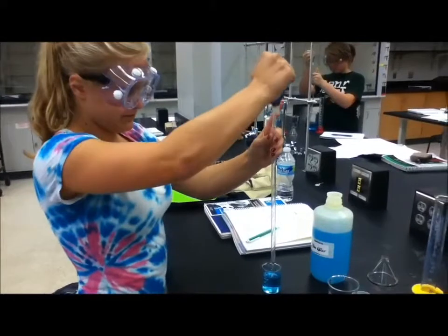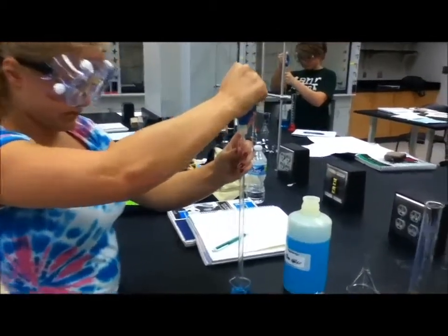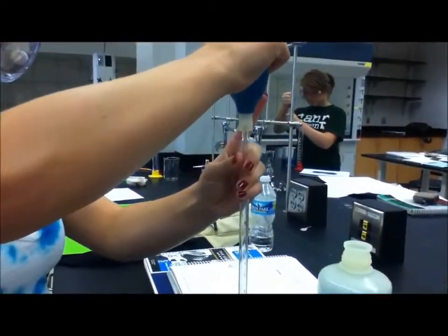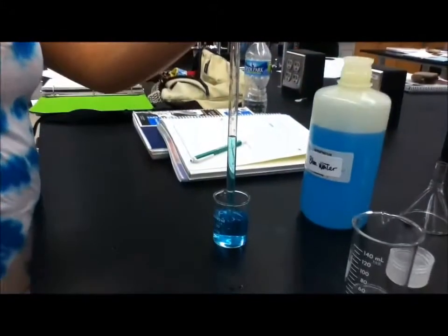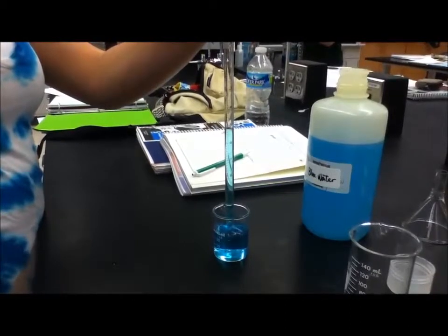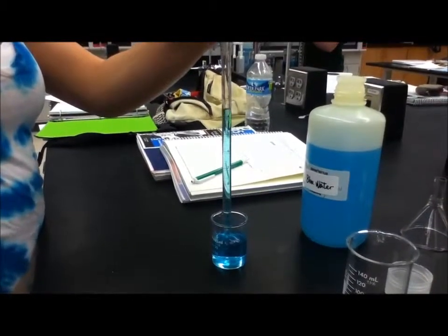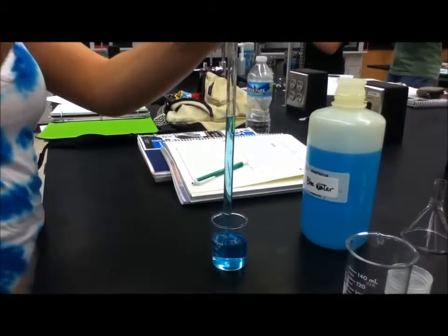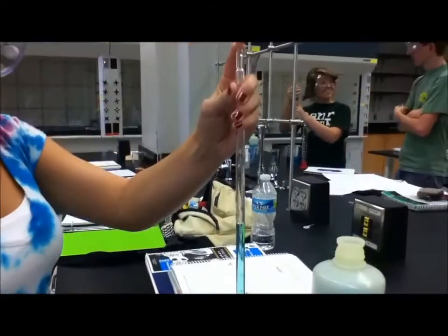Here, Anna is going to properly demonstrate how to use a pipette. She starts out by squeezing the bulb and placing it on top of the pipette while submerging the solution. Make sure the pipette is not touching the bottom of the glass or near the surface. To draw a solution into the pipette, release the grip on the bulb and go to the desired amount.